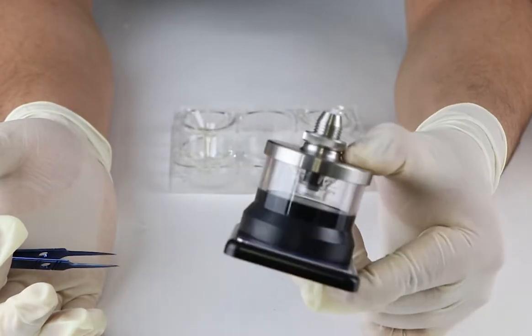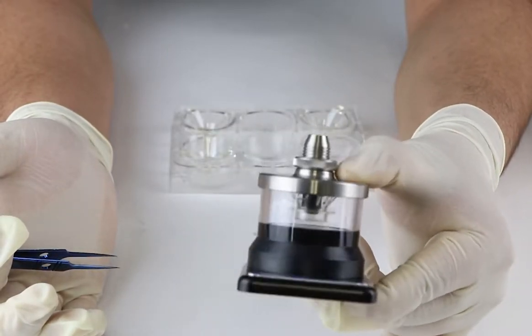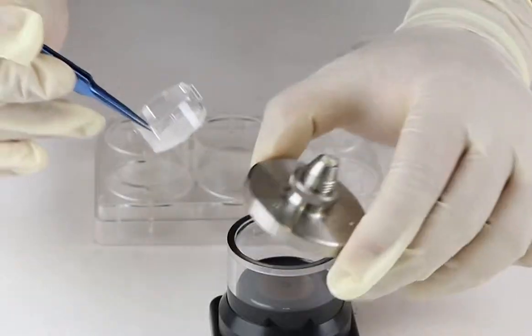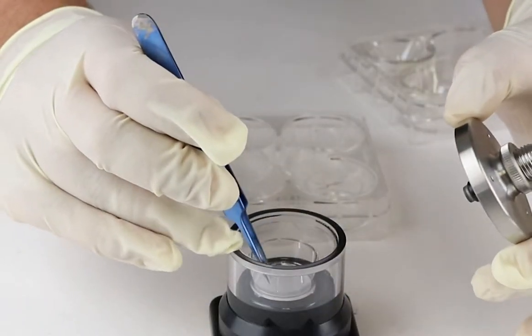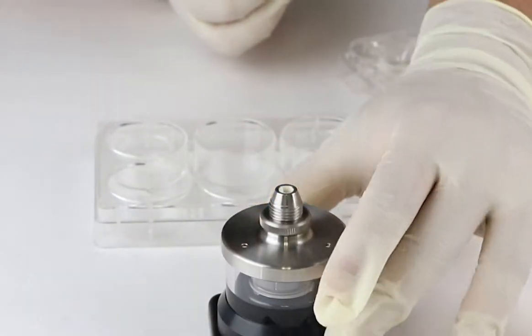Whereas, if a user is using a standing insert, the user needs to make sure that the insert is placed in the center of the endohm chamber.